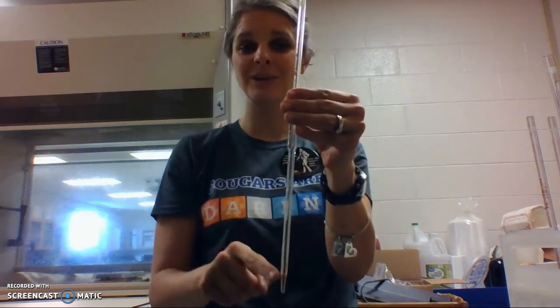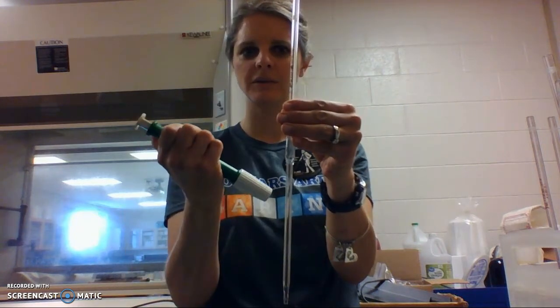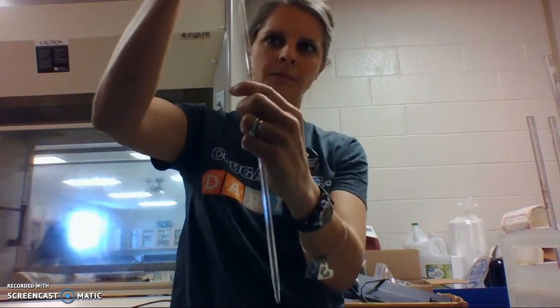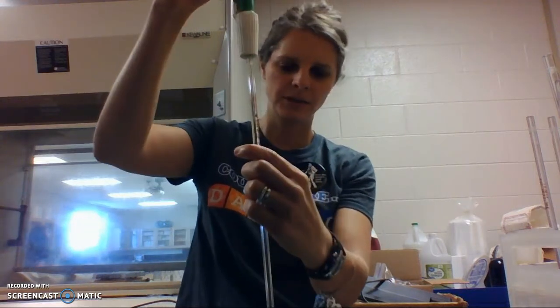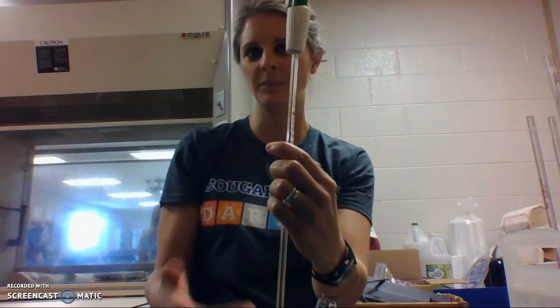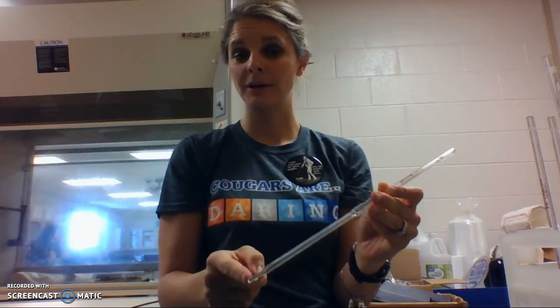To contain means you need that little bit, which means you've got to roll this open a little bit, stick it on the top, and then push it down, which will blow air through it to get that last little bit out. So you've got to be careful with your pipette. Is it a to deliver, let that little part stay there, or is it a to contain? You have to blow it through.